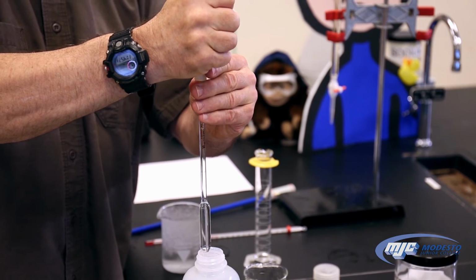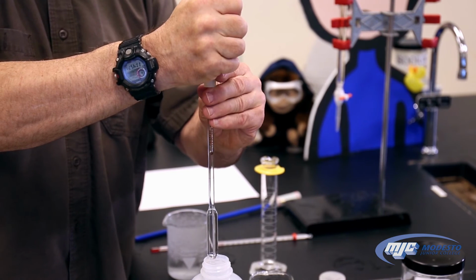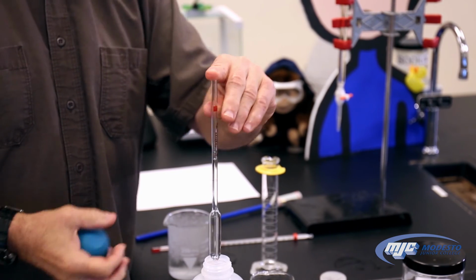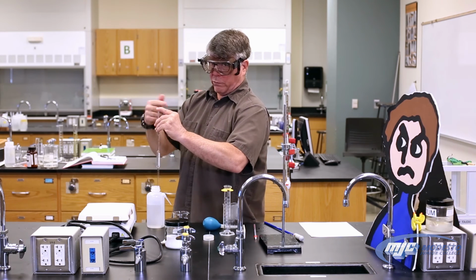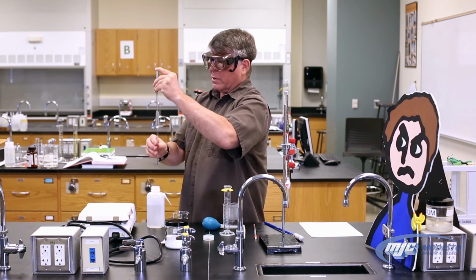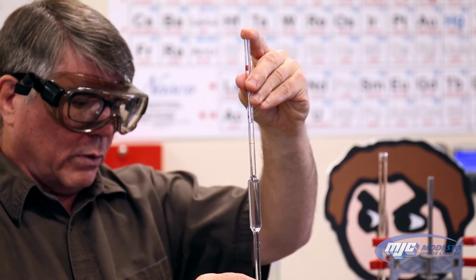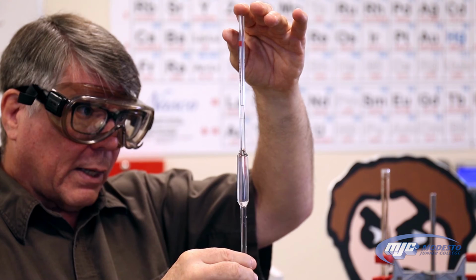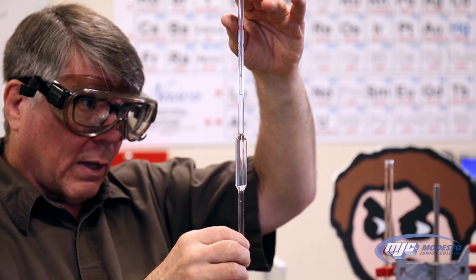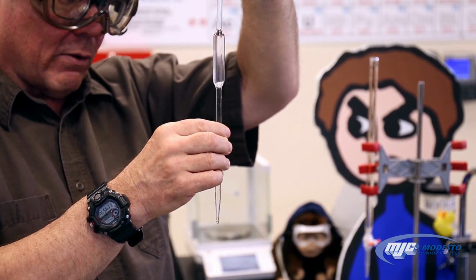Now with it up there, we want to make sure we don't get any water up in the bulb because then everything gets hard. Take off the bulb real quick, and I put my left forefinger on top of the pipette. Now this part is why it's important for all that stuff to be dry, because what we do now is I'm going to look at that line, and I'm going to look at the meniscus. I'm going to release a little bit of pressure with my finger and twist the pipette. And I can get a drop at a time to come out. And I'm going to keep doing that until the bottom of that meniscus just touches the top of that line.